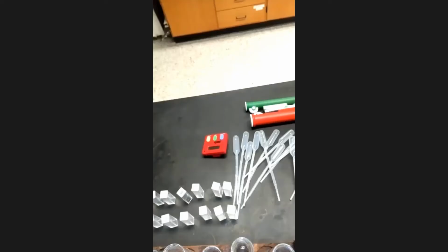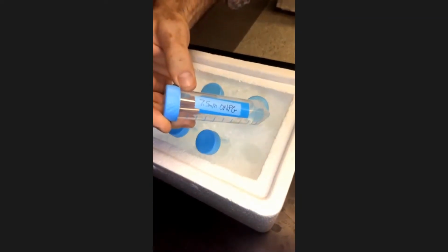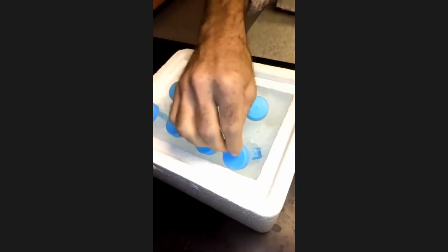And let me show you what we're looking at here. Okay, so we have here, if you guys can see with my camera, a whole bunch of test tubes set up. And we're going to put a few different reaction components into those test tubes. We will have the substrate itself. These are the tubes of ONPG. That's that molecule I just showed you, which has galactose and the ONP dye on it. So that'll be our substrate. We'll be adding that into the tubes.